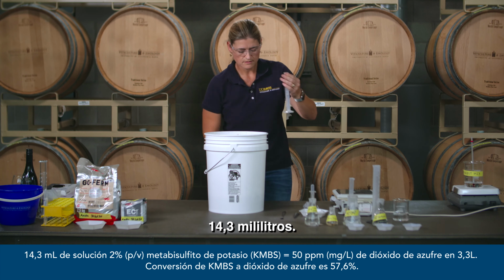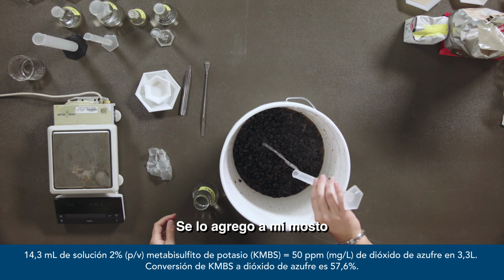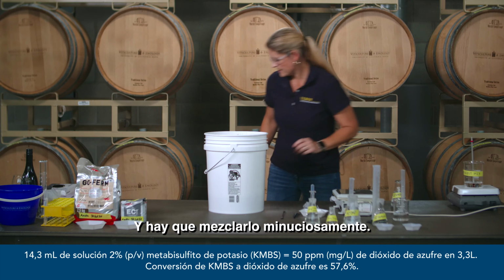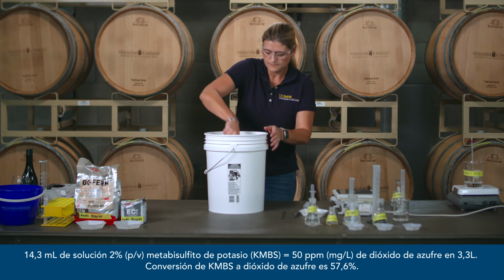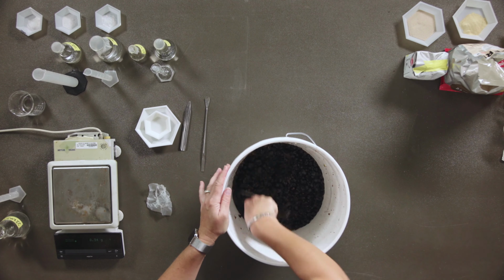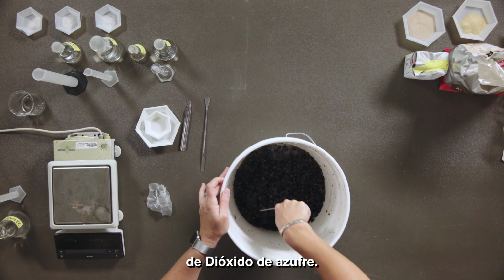14.3 milliliters. I'm adding it to my must. And then you need to mix that in thoroughly. You don't want one spot of concentrated sulfur dioxide.